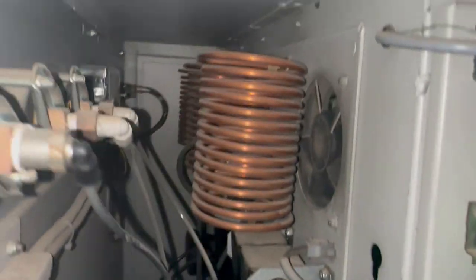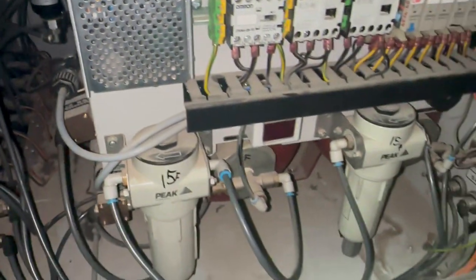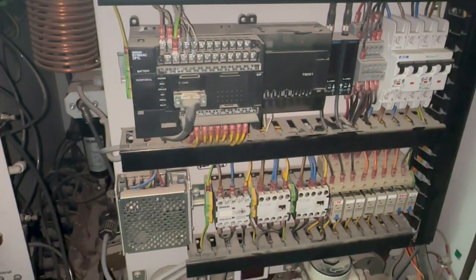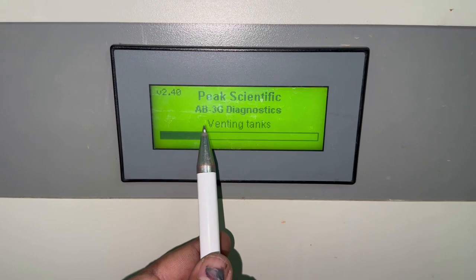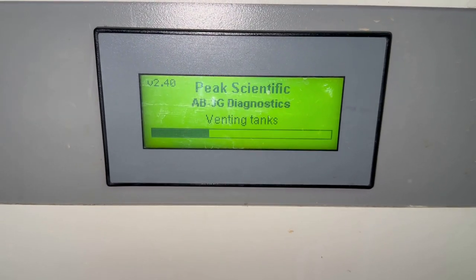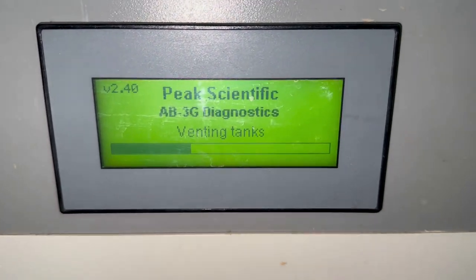Here we have the cooling coils with the fan, and we will troubleshoot all those things. So let's proceed. Now I have just switched on the system, and initially it runs its self-diagnostic, and in its normal operation, first it vents all its tanks.